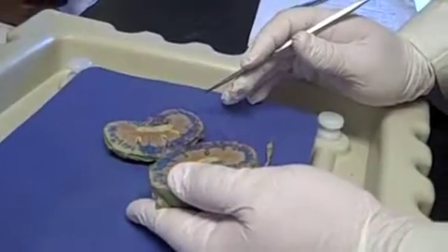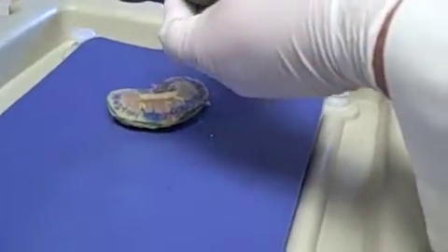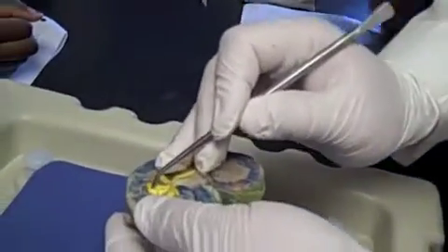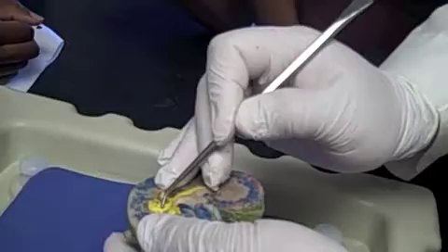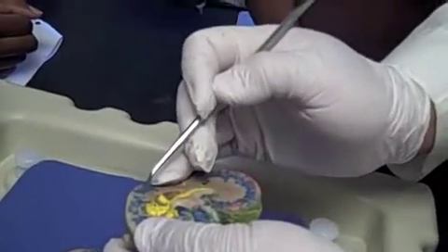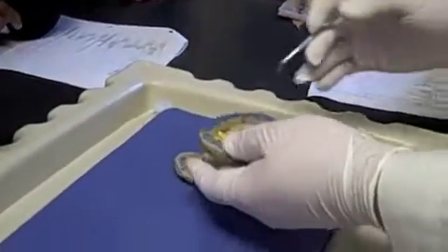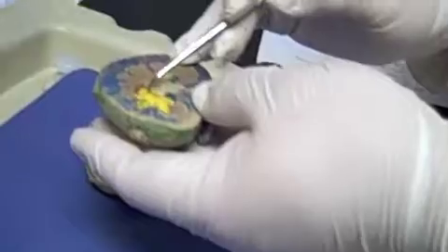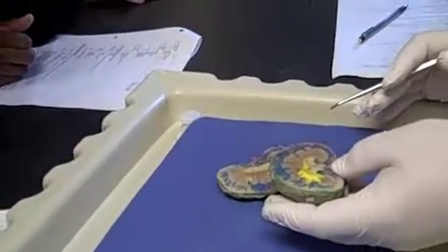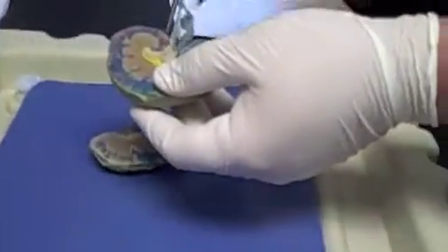And what's going to happen to that urine from the minor calyces right there and right there, they'll coalesce with one another, okay, to create a major calyx right there, right there, right there. Urine that is collected in a major calyx will run into a renal pelvis, this flat structure right through there. And then eventually, what's going to happen is the urine collected in the renal pelvis will simply travel out the ureter.